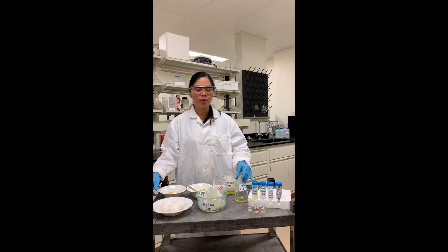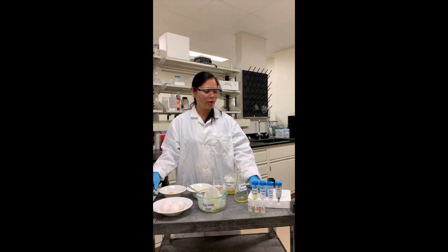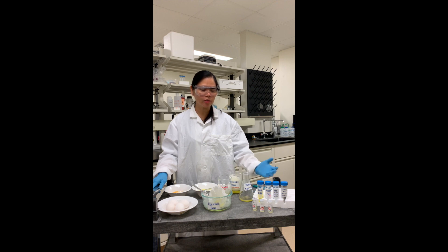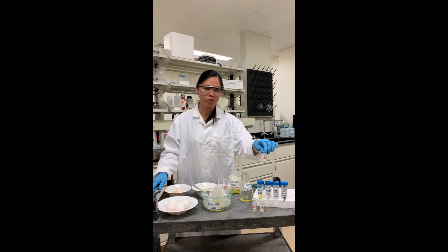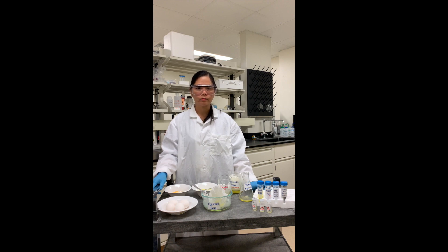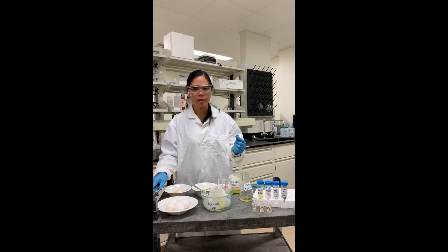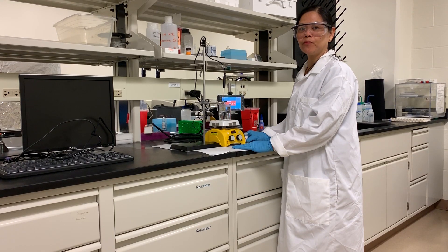Now that you have prepared your filtered egg white, you're ready to prepare your stock salt solutions using distilled water — one 5 molar sodium iodide solution and one 5 molar sodium chloride solution. You can prepare your samples using a 1-to-3 proportion of salt solution to filtered egg white, or a 1-to-1 salt to filtered egg white proportion. In total, your students will have three test tubes: one with distilled water and filtered egg white, and the other two with salt solution and filtered egg white.